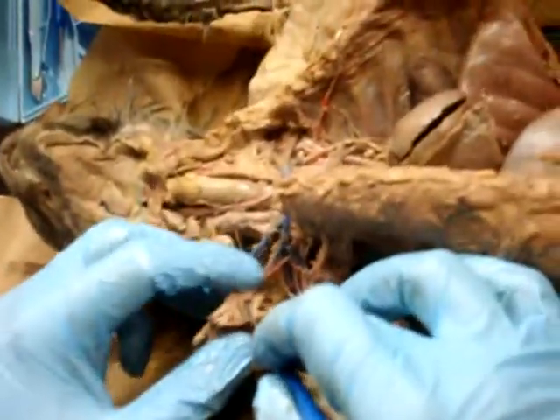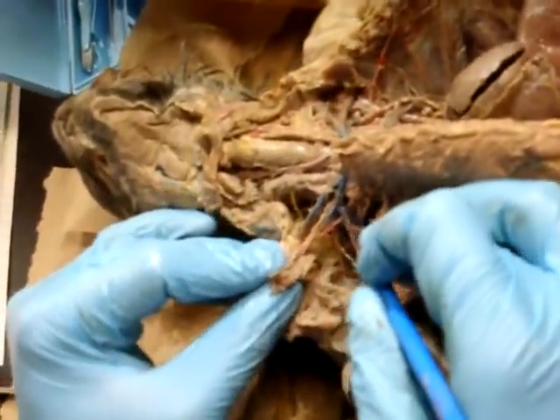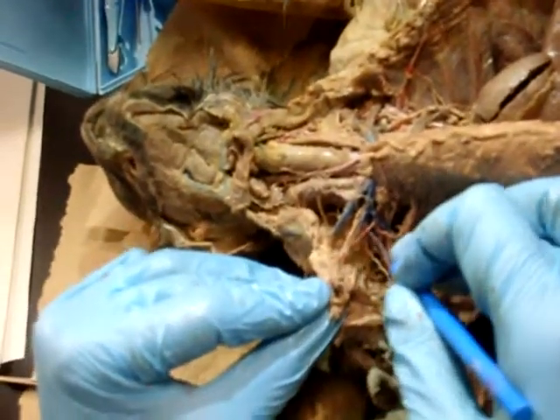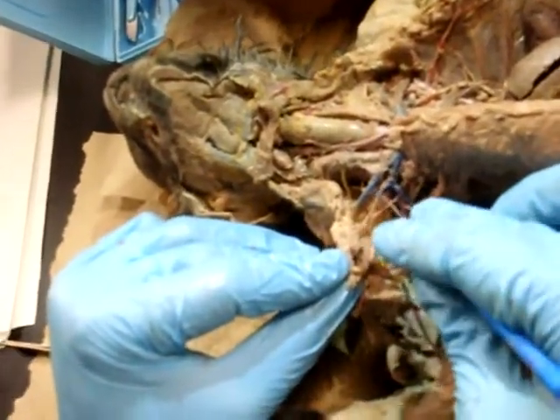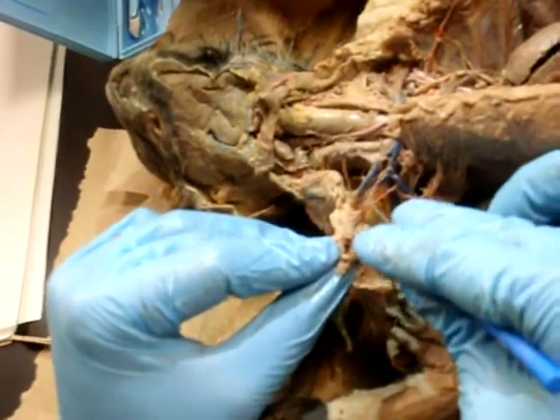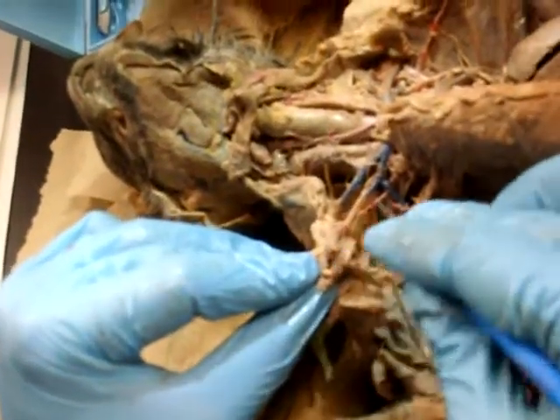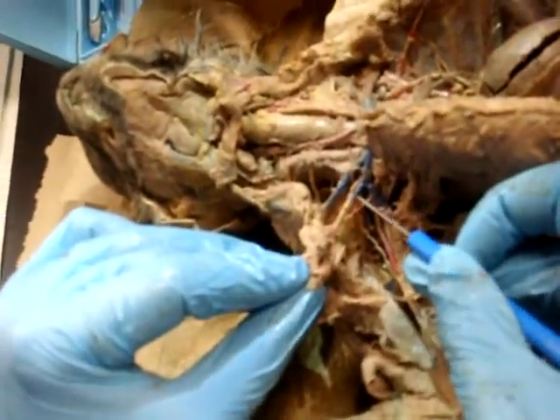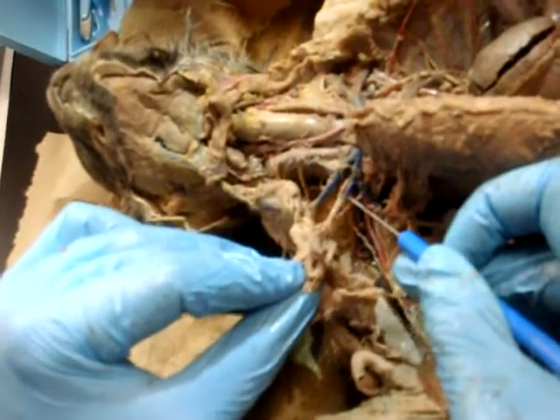It faded out. You see, it started and then it faded. That's why I was looking for the rest of it. But see, this is what it would look like without the latex. It looks all big because the latex goes through. See, the latex faded out in it. So that's what sometimes happens.